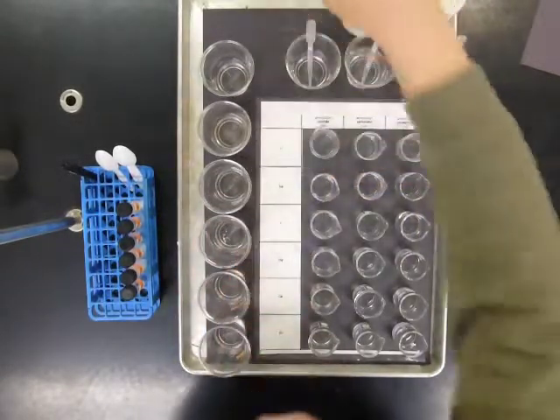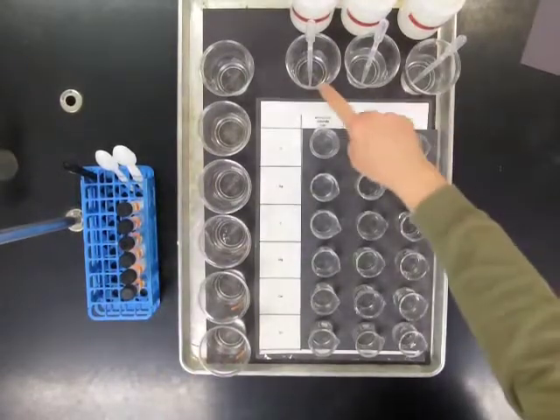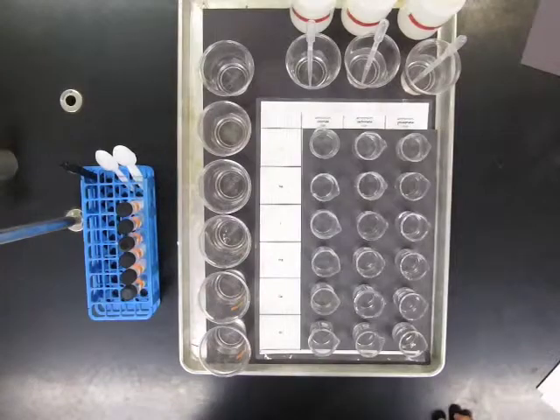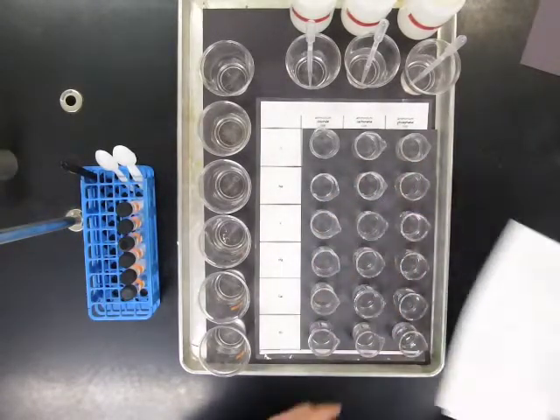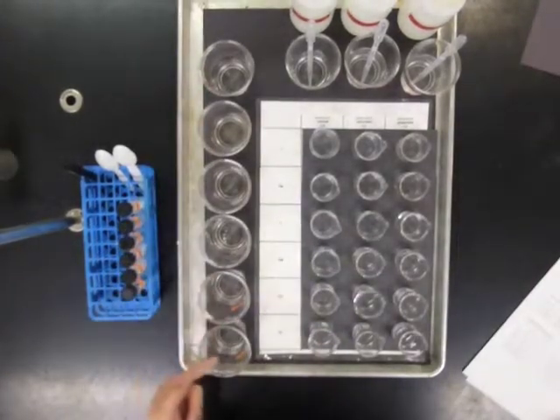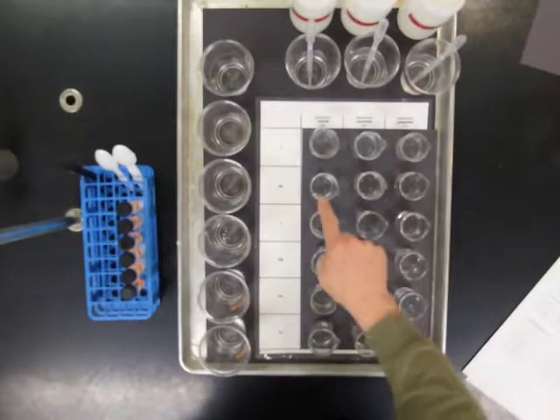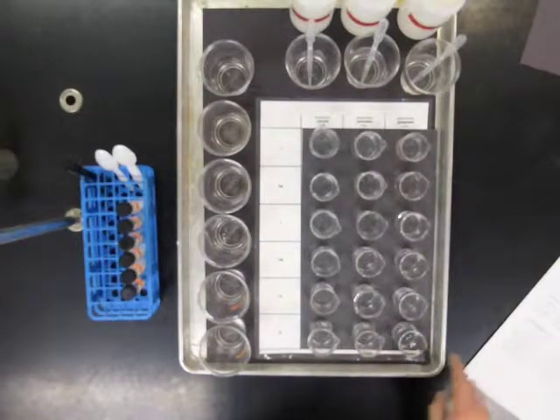We set up an experiment where we would combine each of the metal nitrates with each of those negatively charged ions in all possible combinations. I have right now in these beakers set up in the same order as the data table. I've already put in the 6 metal nitrate substances. So these 3 beakers have lithium, these have sodium, potassium, magnesium, calcium, and strontium substances.